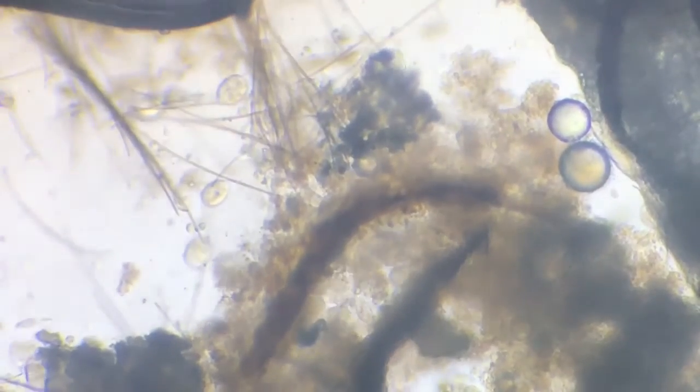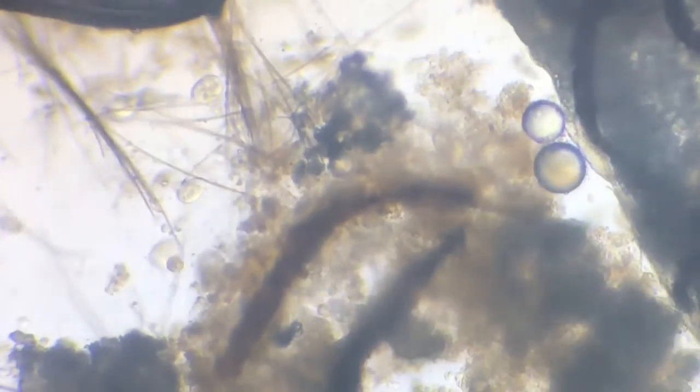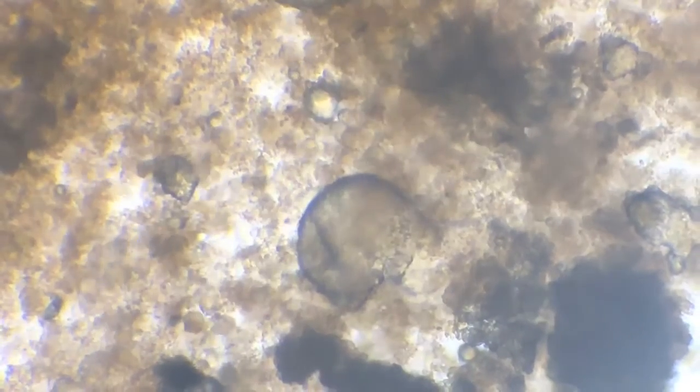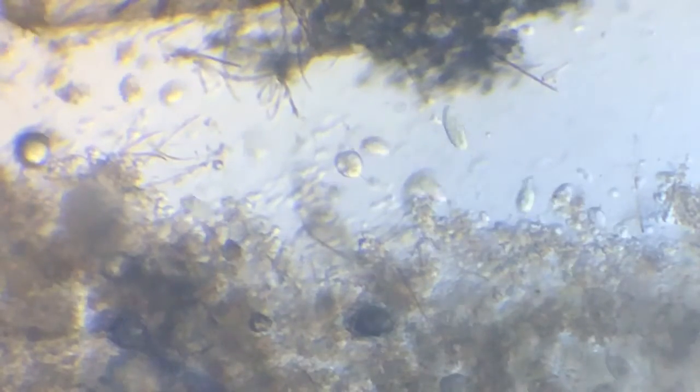There are a few sessile ciliates, the vorticella, attached to the body, and there are numerous other ciliates, smaller ones, and these are just consuming the rich organic matter which has been diffusing in the nearby water. And in certain areas, if I project it, there are certain areas which are so rich with organic matter that there is a whole frenzy out there. It's an open buffet.